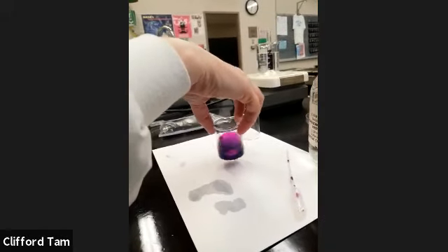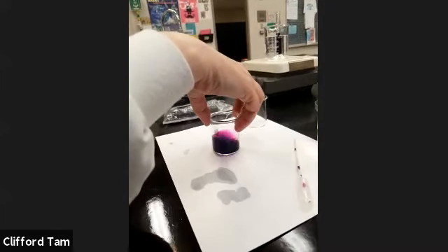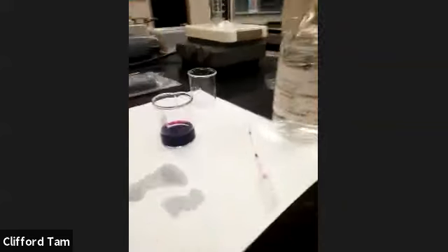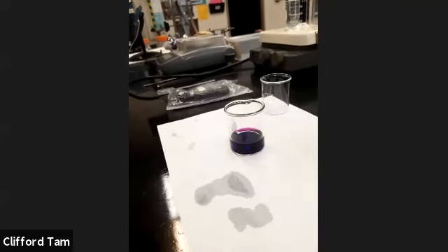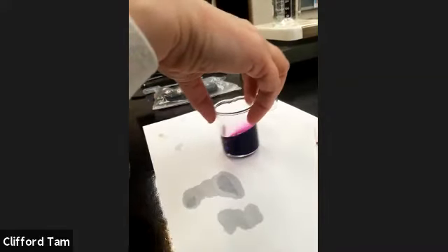This is at room temperature. Right, the room's around 22. Xantha, what are we looking for? We're looking for the permanganate to disappear. It's going to be reacting with the acid, and basically the color will disappear. Excellent. So we're looking for that just to disappear. That's why it's on a white background.